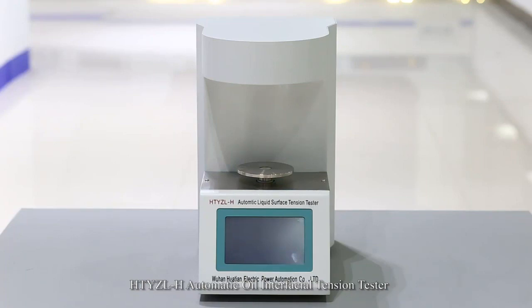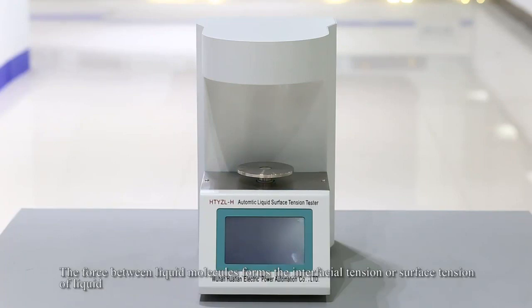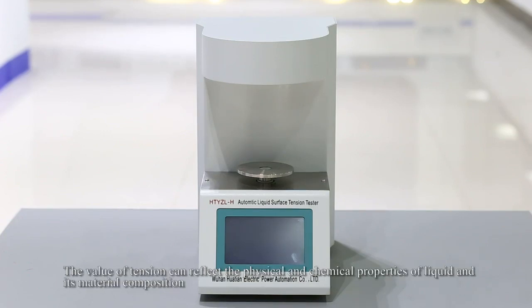HTYZL automatic oil interfacial tension tester. The attraction between liquid molecules forms the interfacial tension or surface tension of a liquid. The value of tension can reflect the physical and chemical properties of the liquid and its material composition.